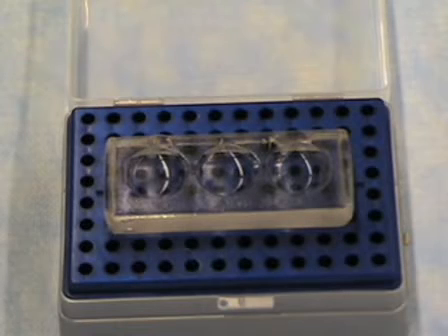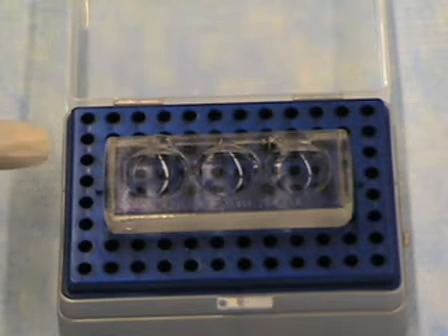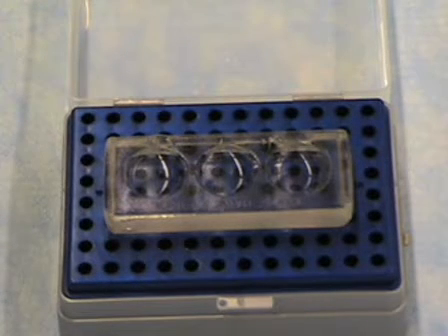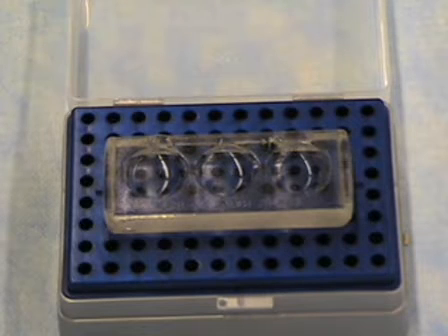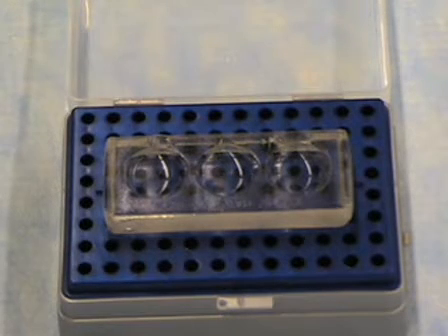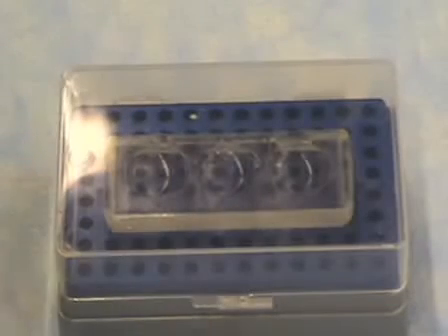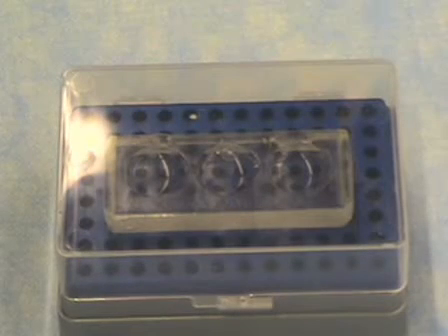A glass concave dish is used to hold the embryos and eggs. They can be placed in each concave circle so that they are in a discrete location, which makes them easier to find. This is placed into this container so that it can be put into a CO2 incubator without using oil on top of the FHM media, or KSOM depending on the media. Water is put in the base, the top is closed, and the liquid stays in place.